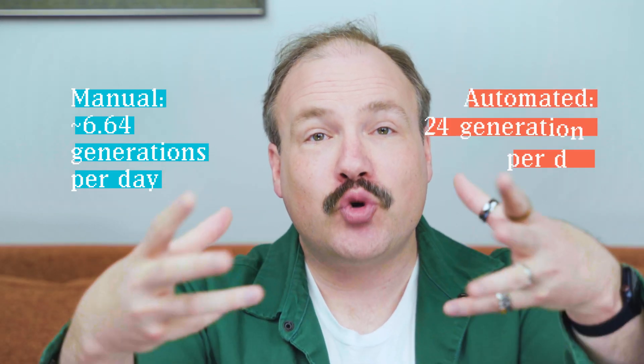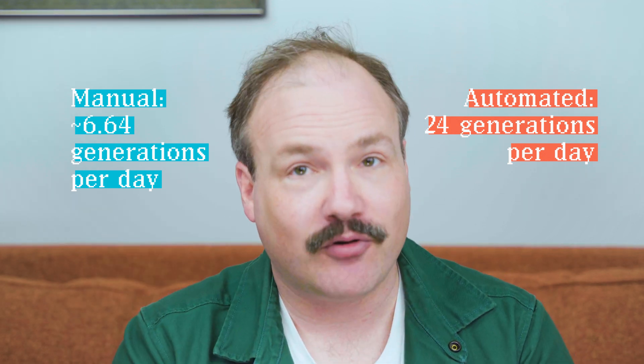In the automated system, we might see 24 generations per day for a typical microbe — that's about three and a half times faster evolution. The automated system can also reduce human error. I'm a pretty good scientist and diluting microbes is as simple as it gets, but I don't know what my error rate would be doing that by hand — maybe 1%. Manual ALE can require hundreds of serial transfers, and those human error rates compound exponentially. A 99% success rate for a single transfer drops to a 37% success rate when you have to do it 100 times in a row. This is the secret sauce for a good automated ALE system: moving liquids around is simple, but doing it with no errors for a thousand operations requires many subtle optimizations that took years to perfect.